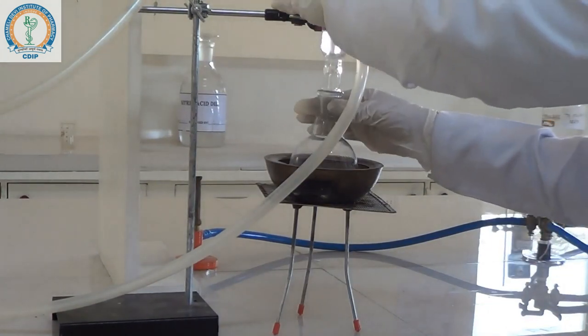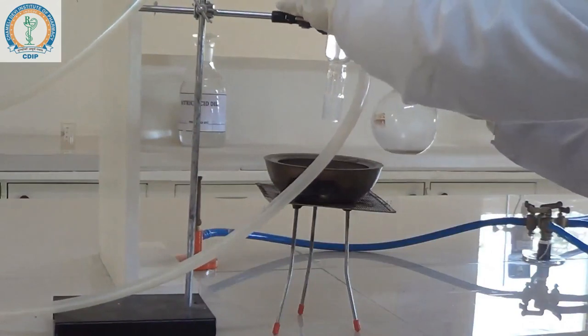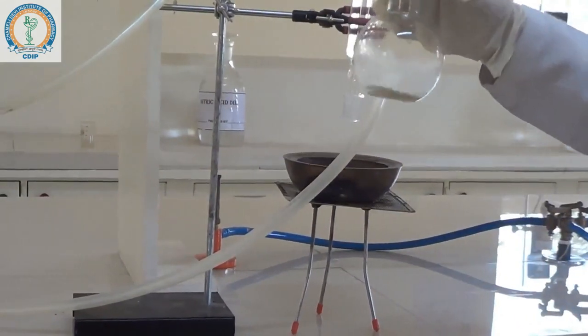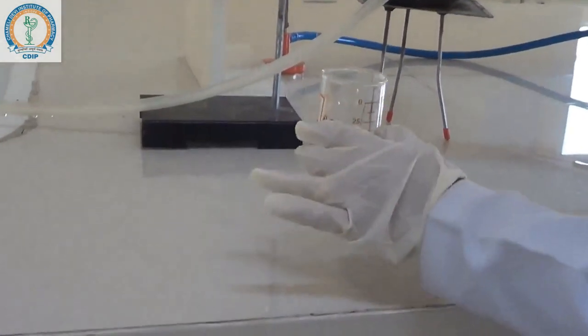After two hours, as we can see the clear solution of the reaction mixture, now pour this mixture into 8 ml of chilled water.